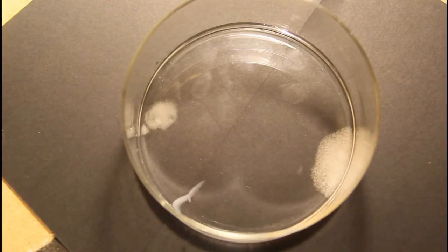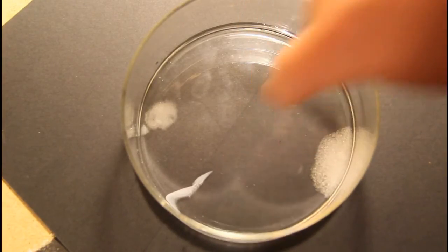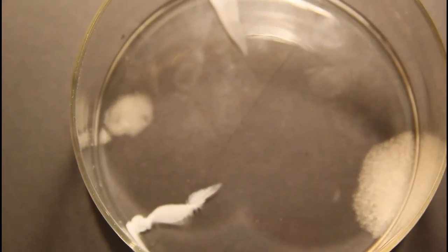Okay, right about here you can start to see precipitate forming. And that precipitate is silver nitrate. I mean silver chloride.